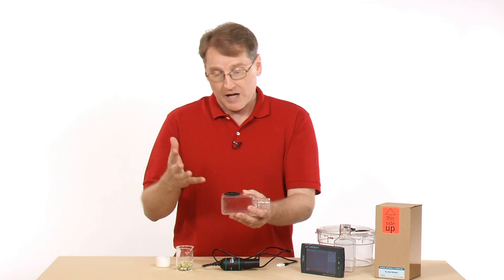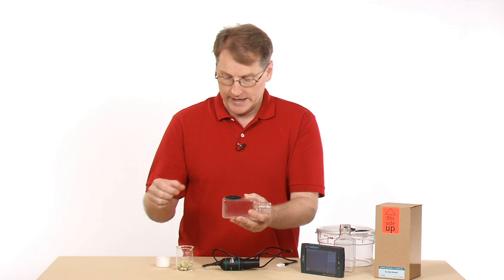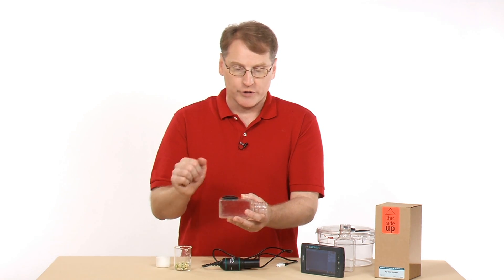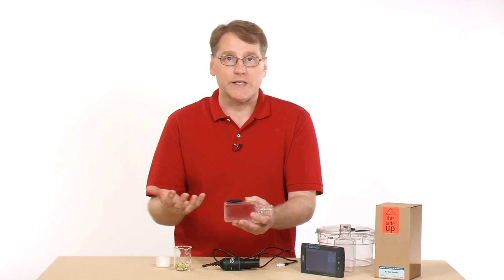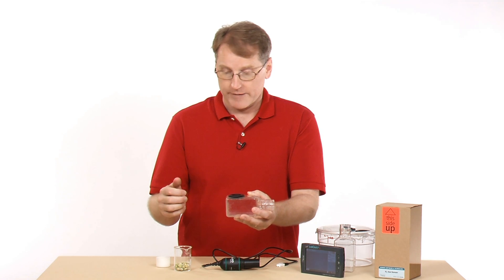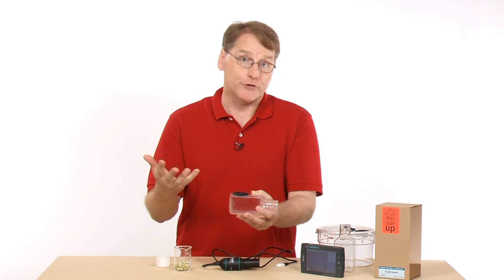So I'm going to do a little data collection here. And so I have some peas that are germinating, and I'm going to put them in the bottle here. And we'll look at what happens to the oxygen level in this container as the peas are germinating.